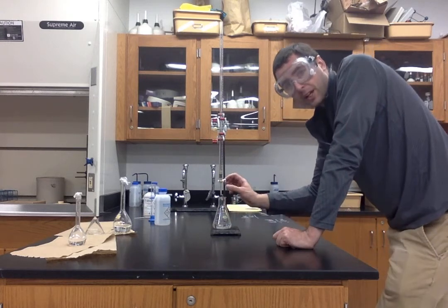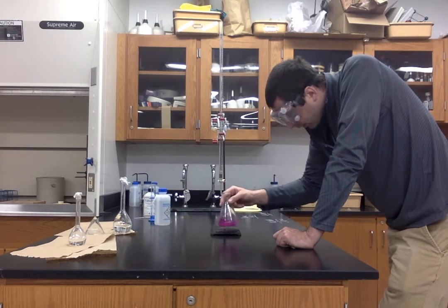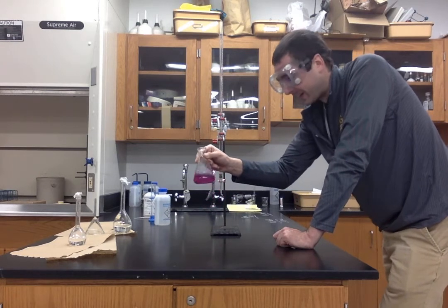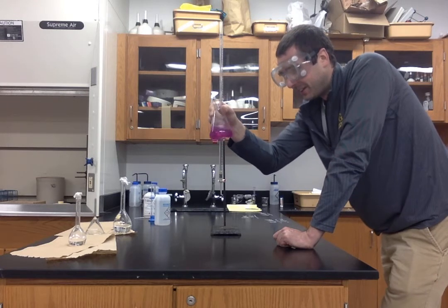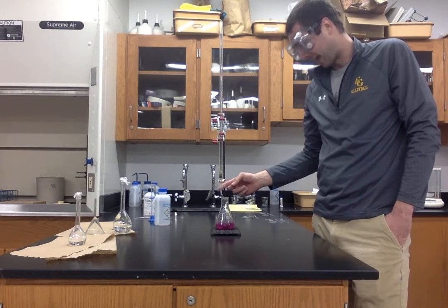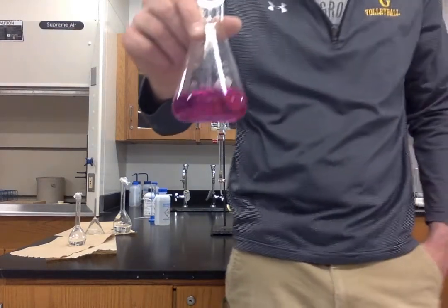Thought I got a little bit too careless there. One drop too far, ladies and gentlemen, but we're going to use this volume. So this is an embarrassingly too pink solution. I don't know if you saw what I did there at the end. I tapped one extra drop into the solution, and it went from clear to this pink. So full disclosure, I overshot this titration.